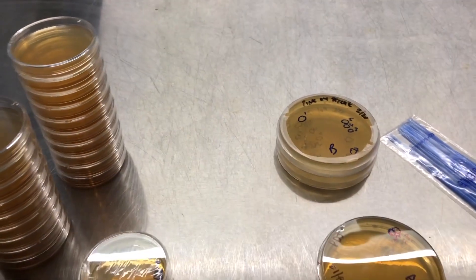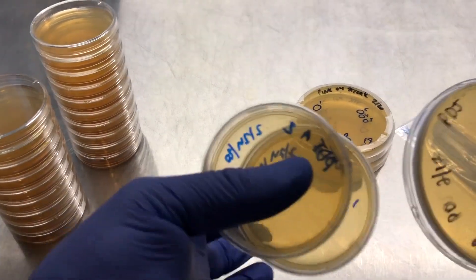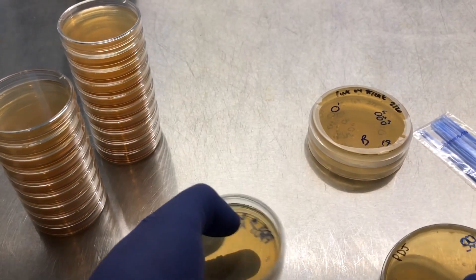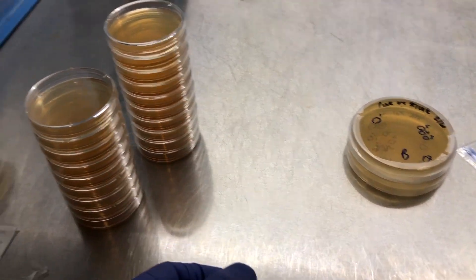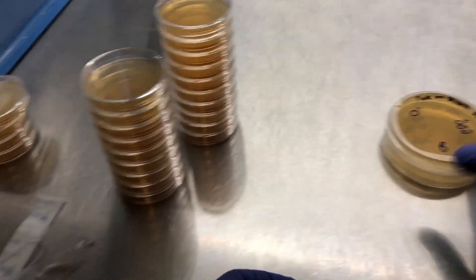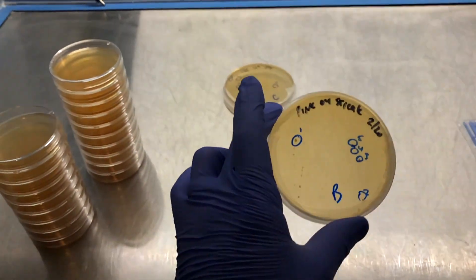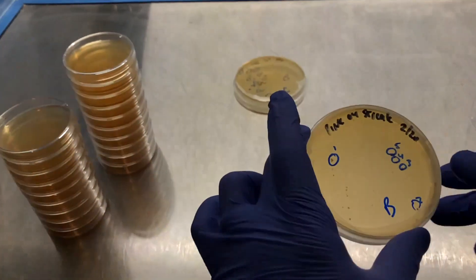All right, so I've got my two isolates from this plate labeled and ready and I'll set those off to the side and now I'm going on to plate B.